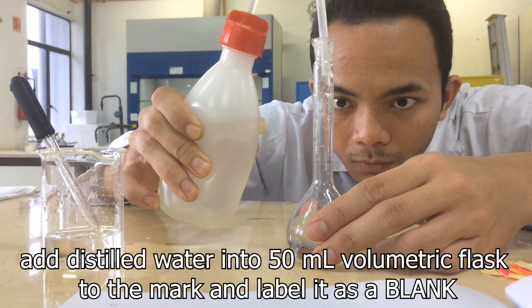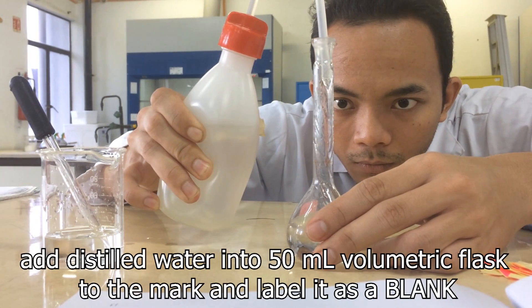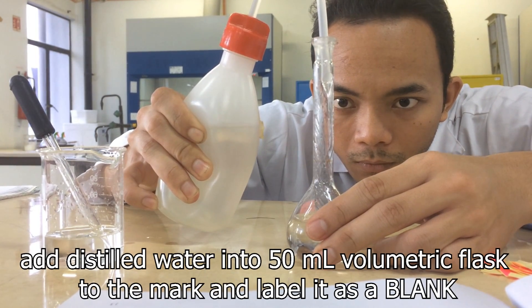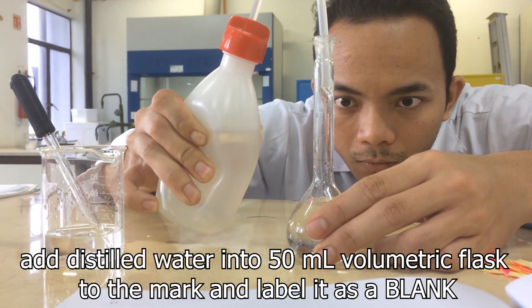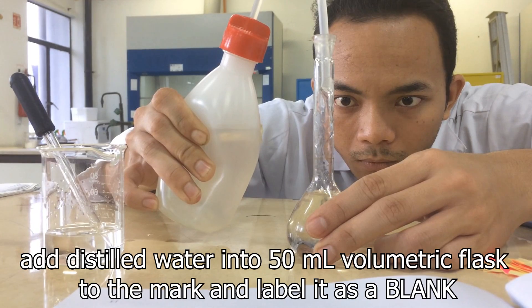Add distilled water to 50ml to the mark and label it as a blank.